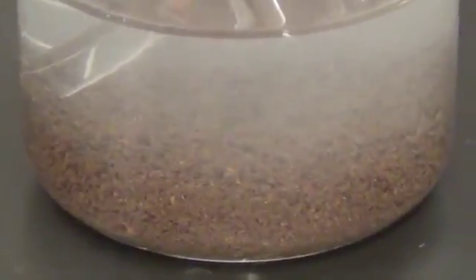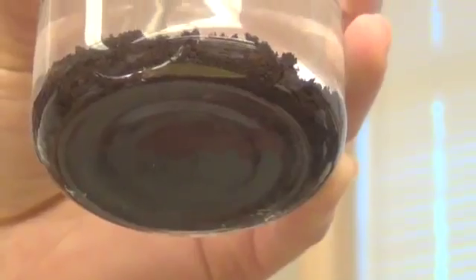Oh, that looks cool. It looks like soil. They're so thick here. Should we stir it around a little more? We can, although you can't improve past a certain point. Yeah, if you want to.